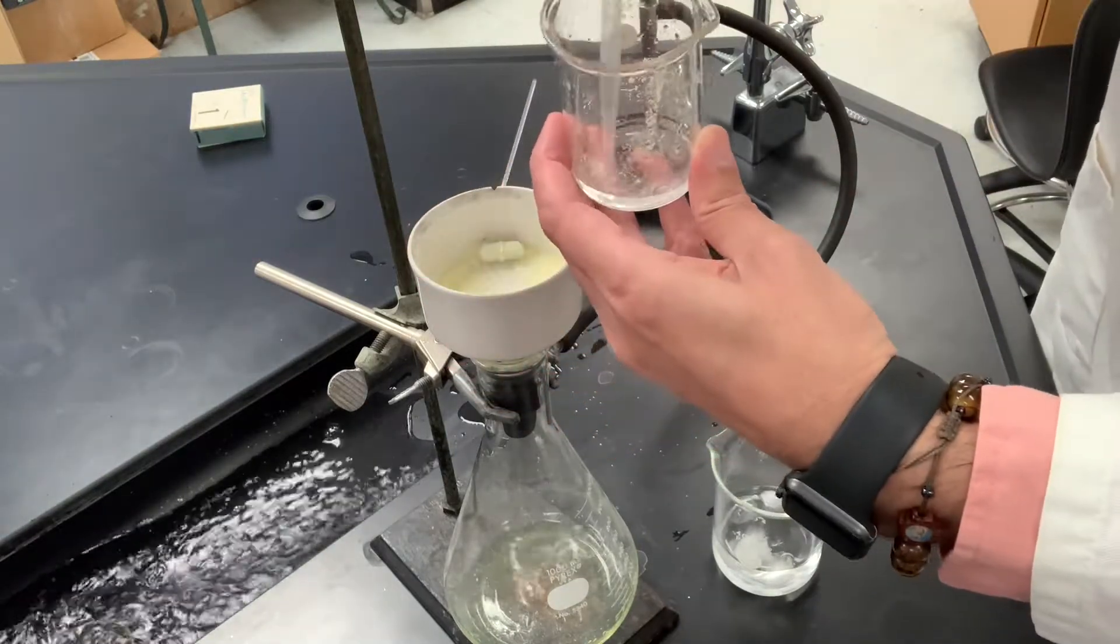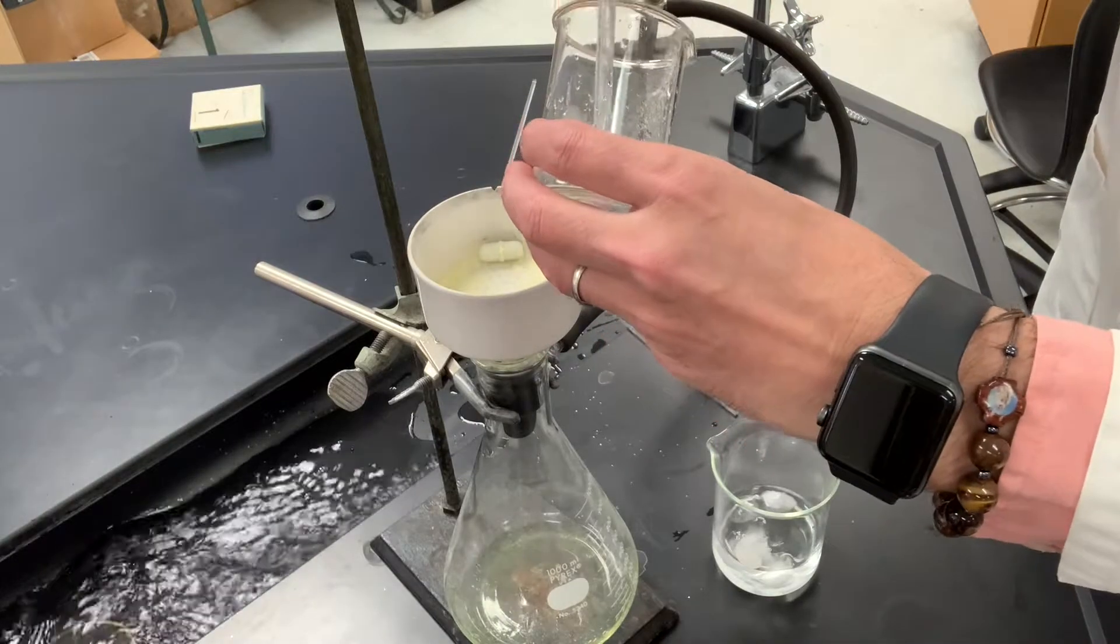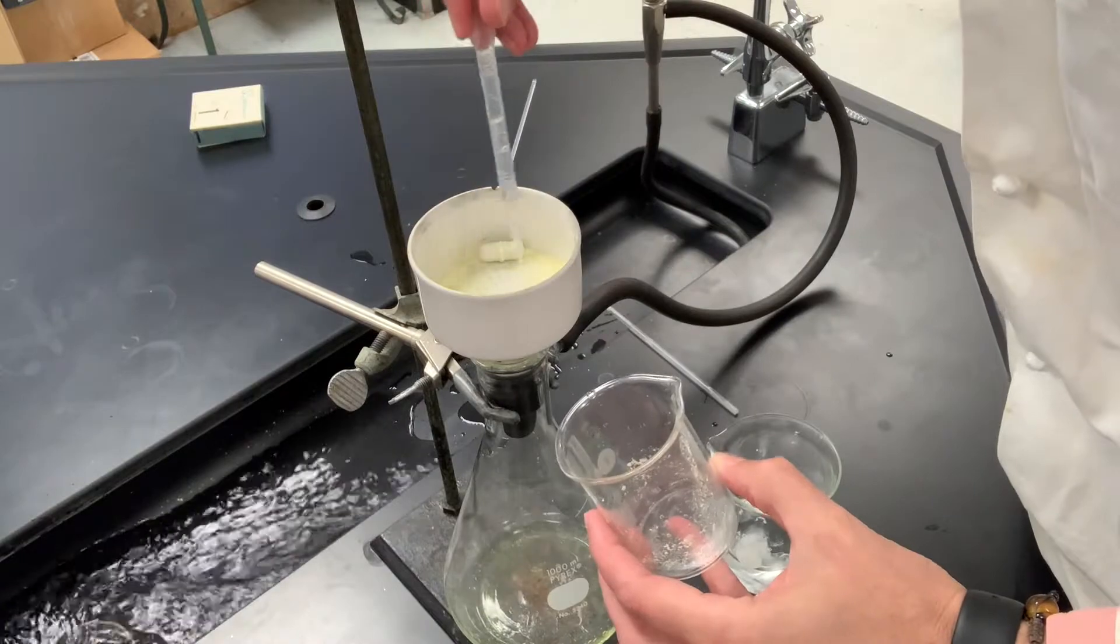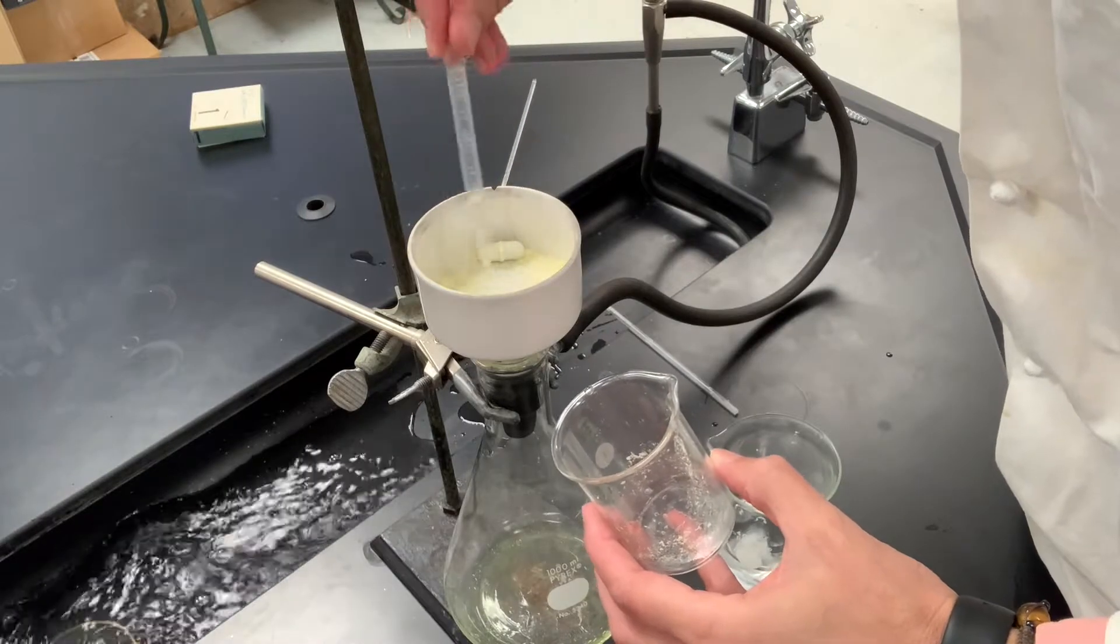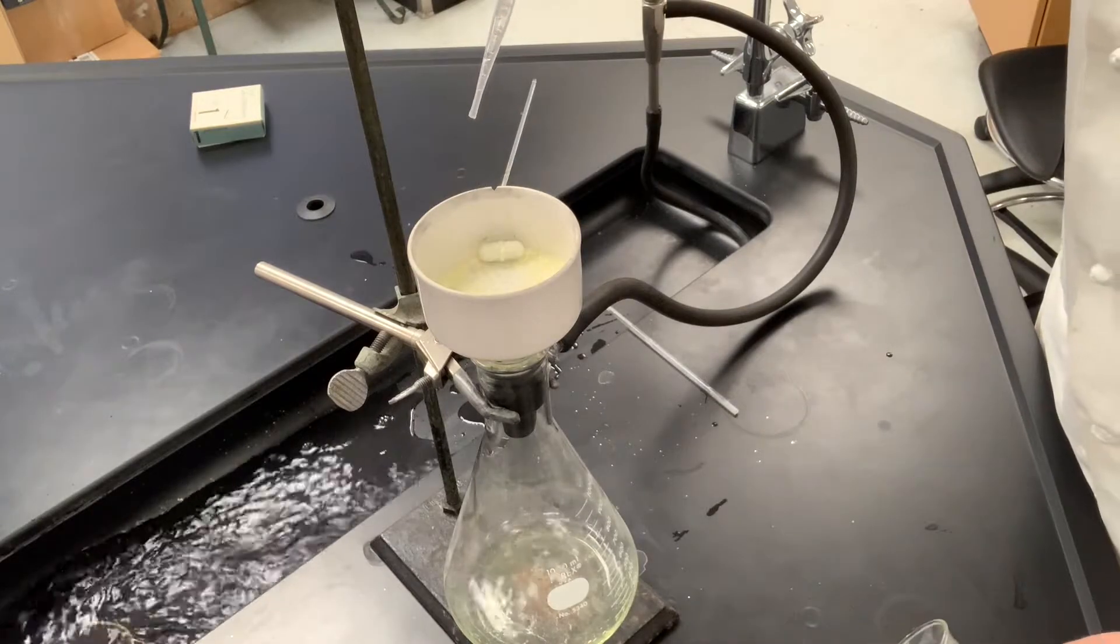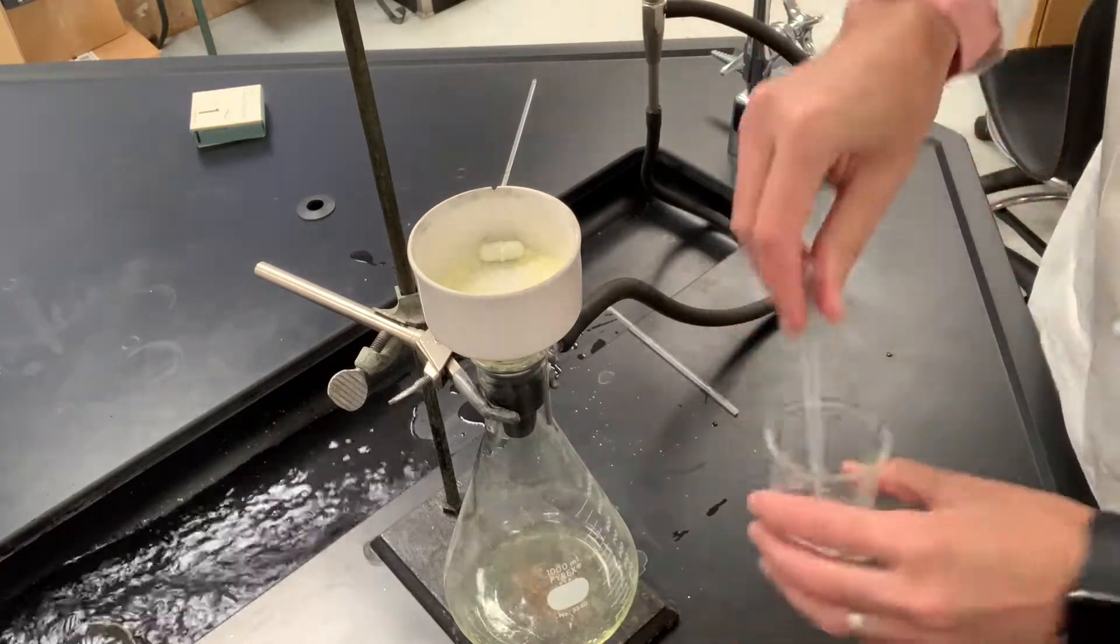That's kind of the best we can do there. Try to get that water dispensed over the surface of the solid there.